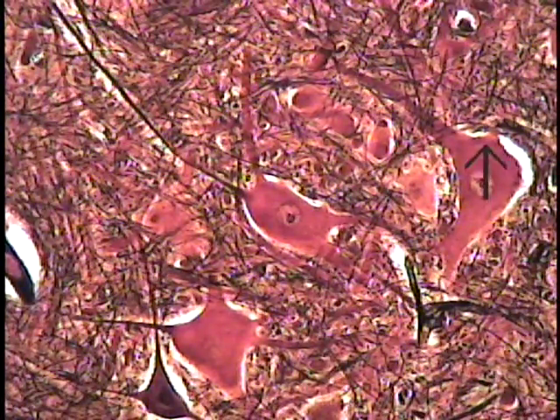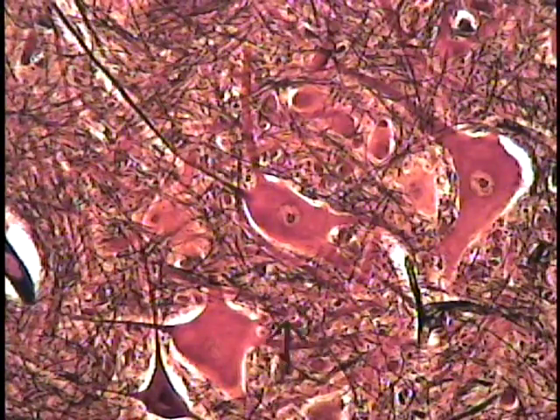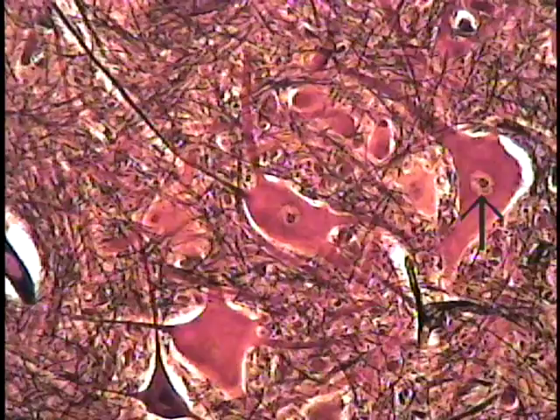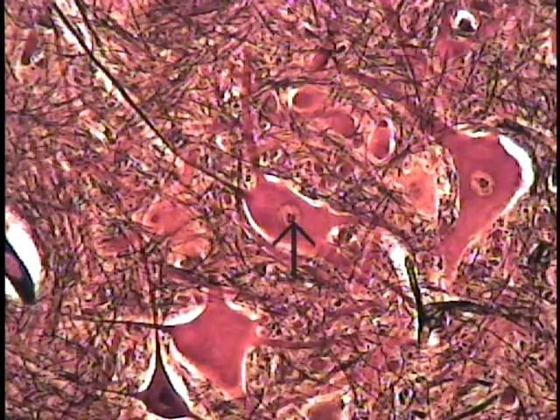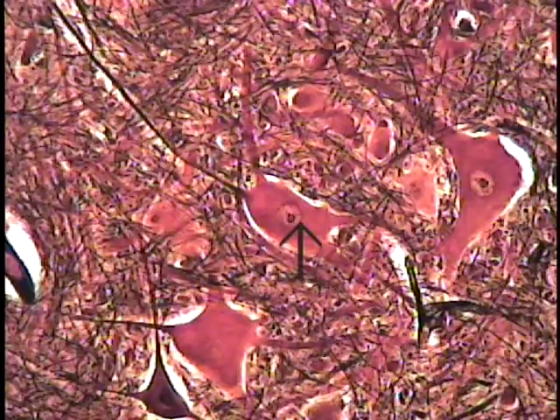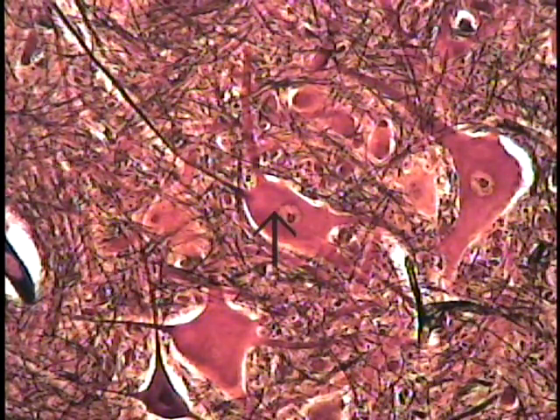The same field of cells seen at increased magnification shows the cytoplasmic extent of these cells drawn out into large processes, very irregular in shape. Within the center, usually, this light clear vesicle is the nucleus, and contained within this particular cell is the nucleolus, as it is present in this particular nerve cell. The nucleolus, the nucleus, and then the surrounding cytoplasm.